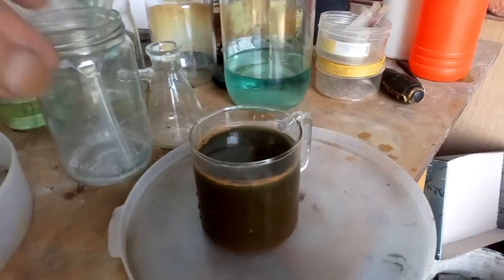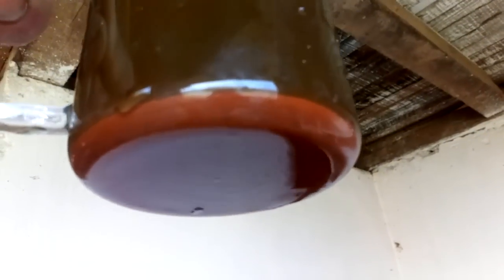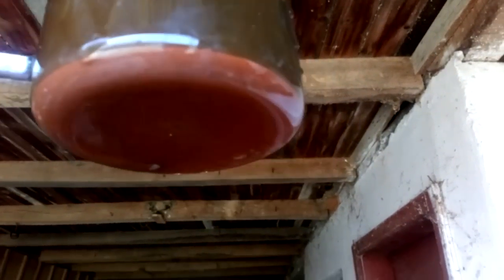This is red brick palladium. Let's see if we had some deposit — yes, we got some. Now I start to filter that. So now I'll leave that, let everything settle down, then filter that, and we'll go to melt.